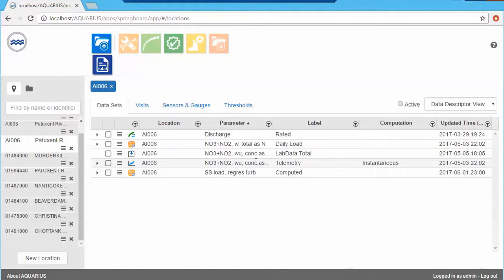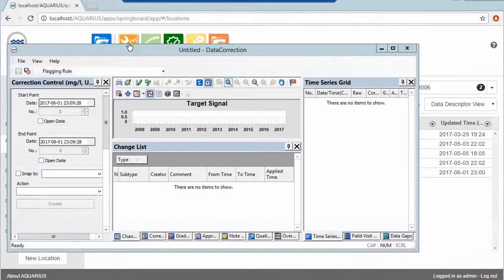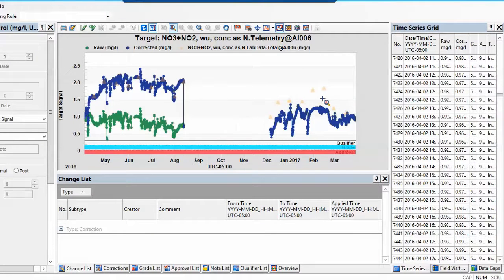So we can see right here, here's some nitrate coming in via telemetry from a sensor. And here I can see, this is my lab data, my lab samples from Aquarius Samples that we just saw within Aquarius Samples. So all I have to do is to check these two and bring them up in my data correction tool. And what that's gonna do is show me my continuous signal with the lab sampling data overlaid over it. So this lab data is brought in via an automatic sync.